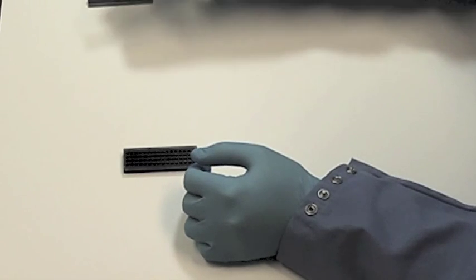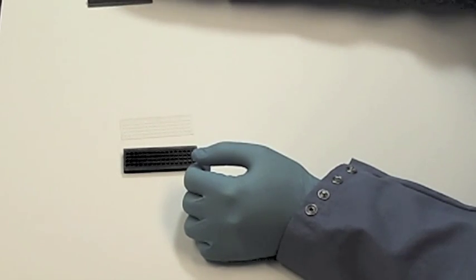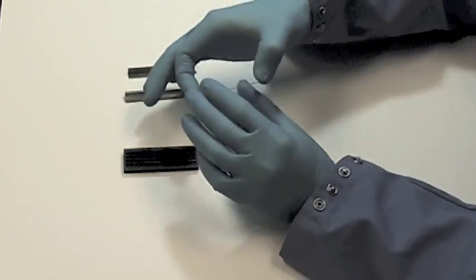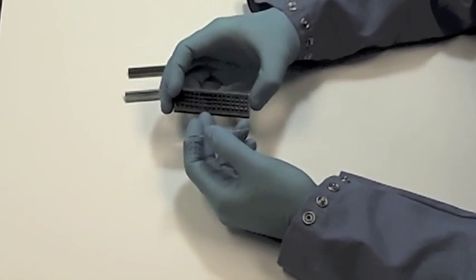Assembling the ProPlate system requires the chamber, the slide, and clips that bind the chambers to the slide. Shown here is a chamber assembly for 64 subarrays on a single slide.